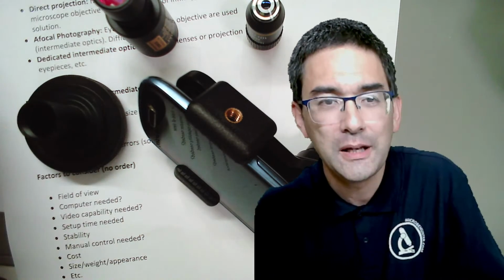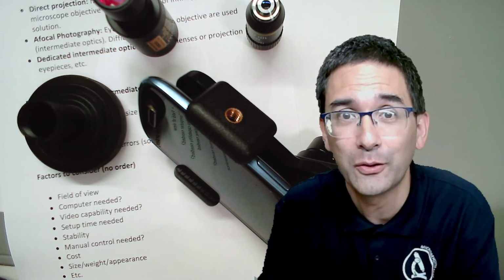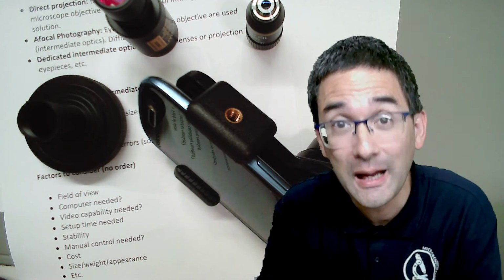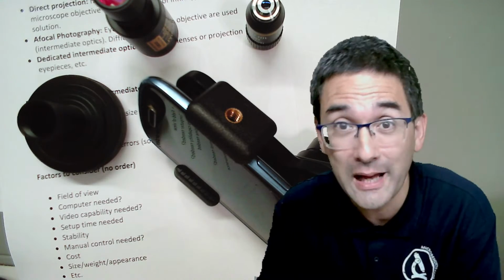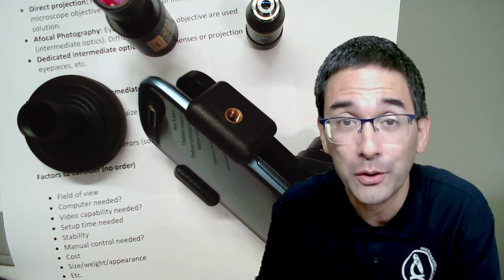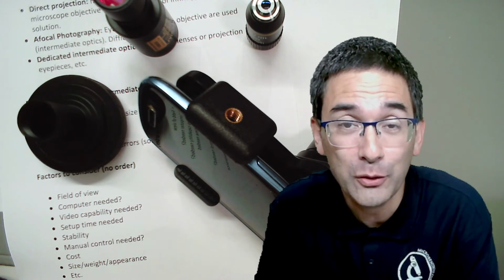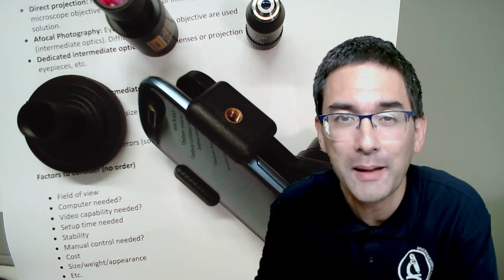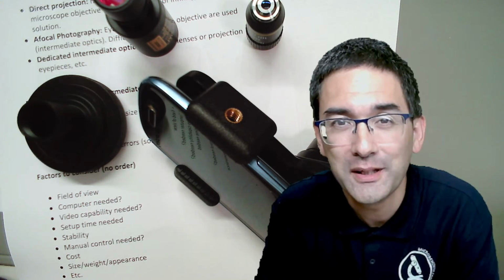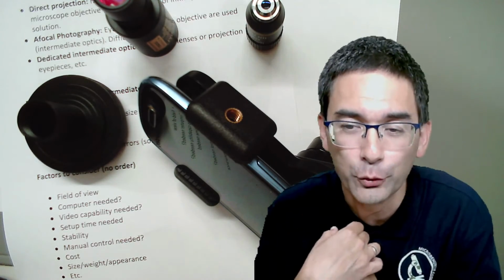And today I'd like to explain to you different ways of connecting a camera, mobile phones or cameras, microscope cameras, digital SLR cameras, and so on, different options to a microscope. And I'm going to also give you some slightly theoretical background material so that it's going to be easier for you to get a better overview of the different options.